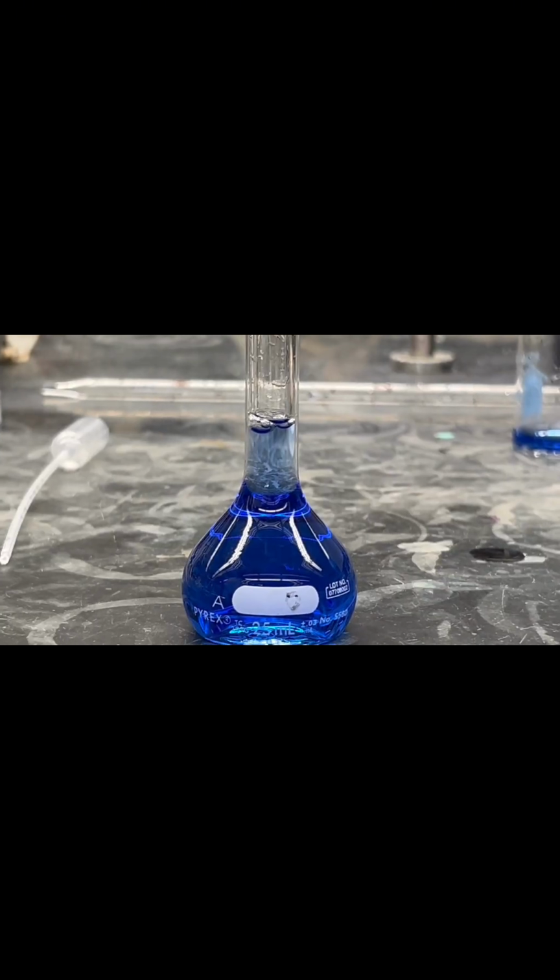We have our diluted solution, but how do we determine its concentration? We can use the formula M1V1 equals M2V2 to figure out the concentration or molarity of the dilution. M1 represents the molarity of our stock solution, which is 0.02 molar, and V1 is the volume of our stock solution, which is 9.02 mL. That leaves M2 and V2 representing the molarity and volume of our dilution, respectively.